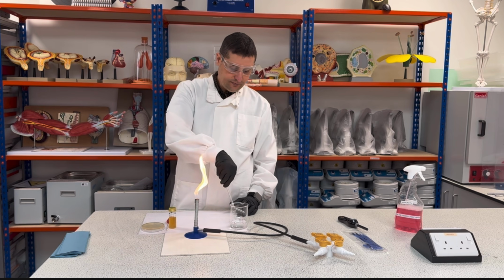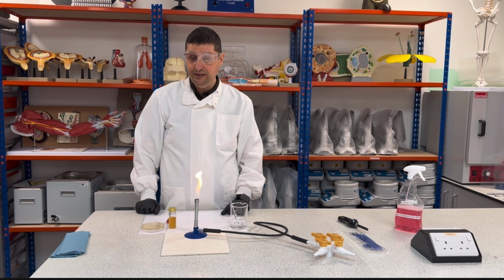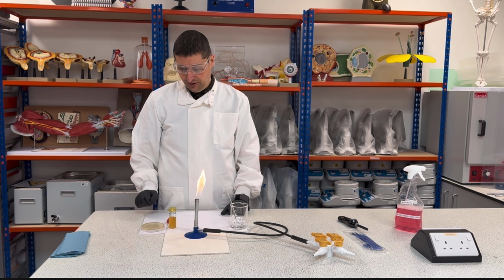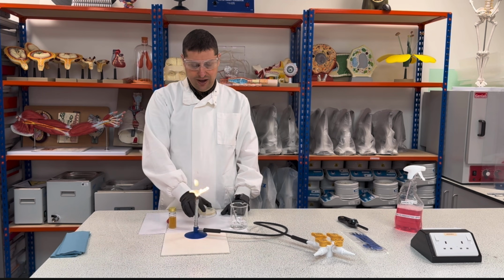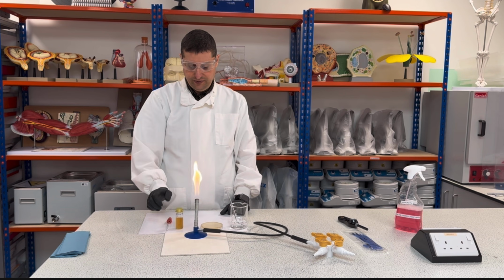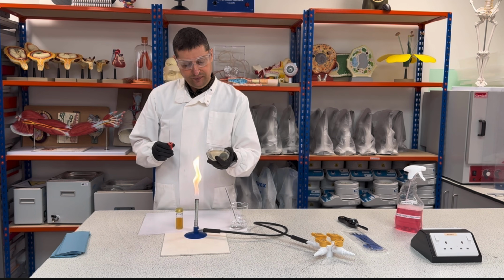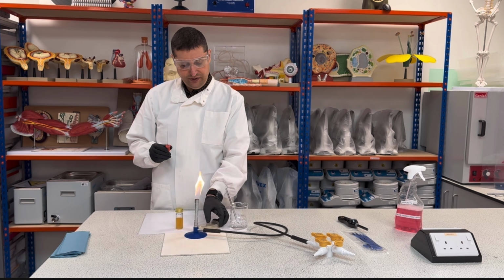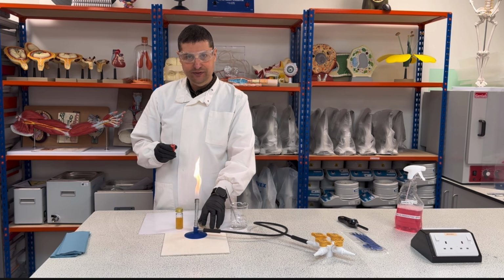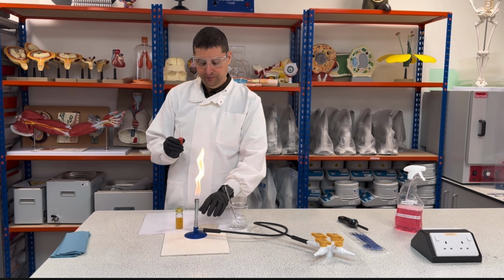So the first thing is I'm going to leave this in here in the ethanol 70%. The ethanol 70% is a concentration enough to kill the bacteria, okay? And I have my Petri dish here and my broth. So the first thing I need to do is put my dish with the agar facing down, okay, in the bottom, and the lid facing up, right? So I can just open up and close this up.